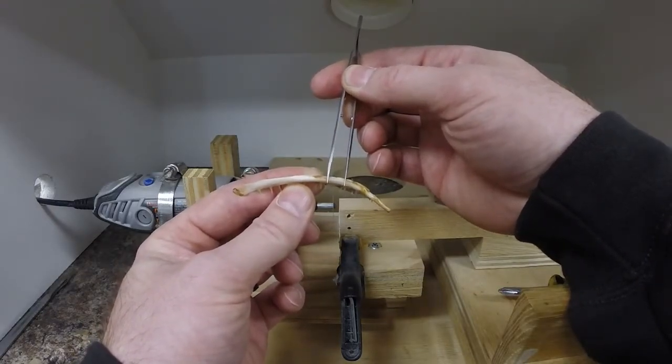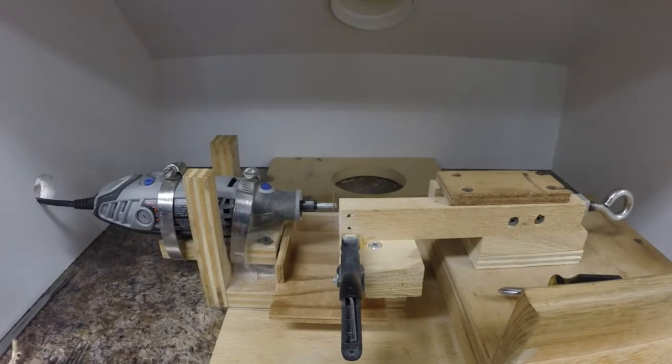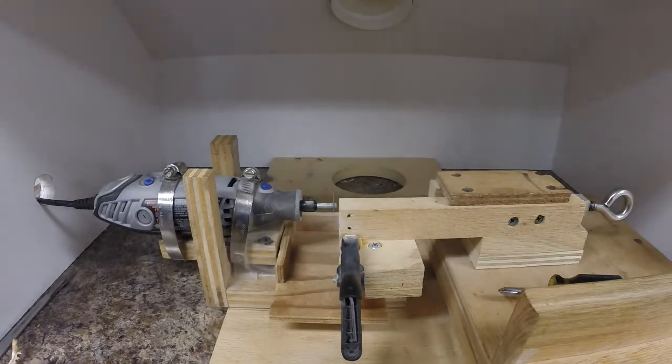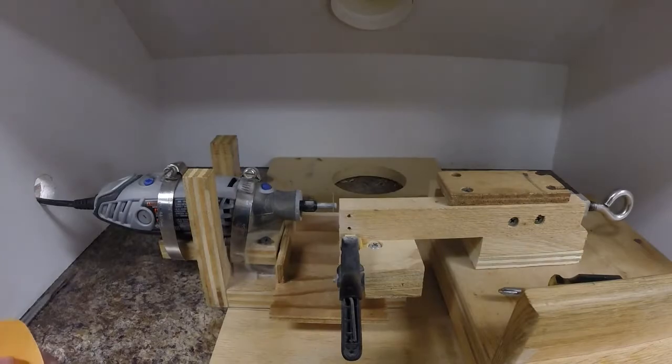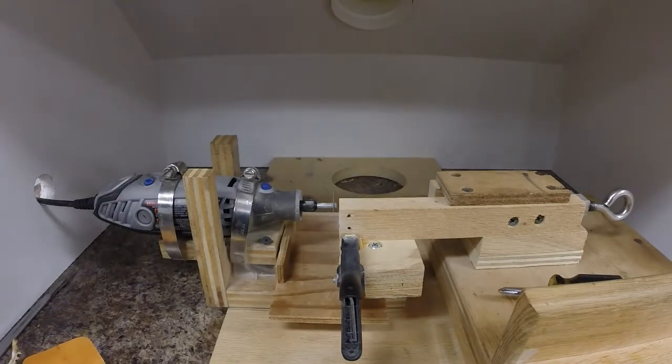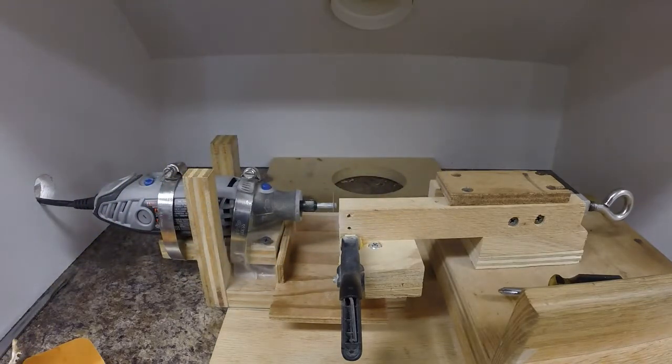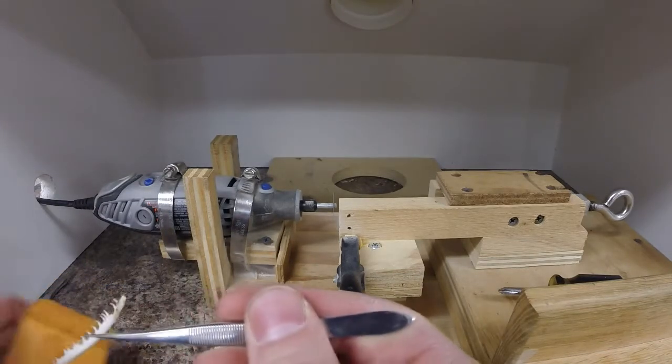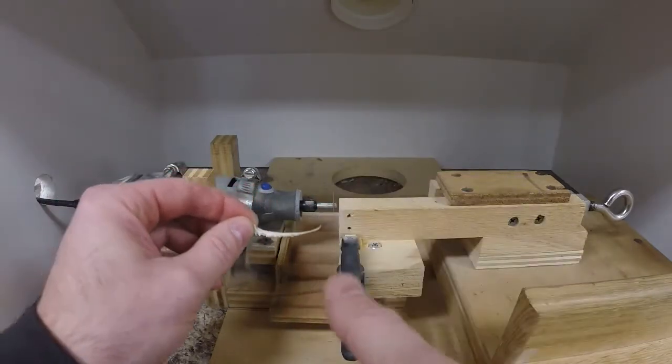So I will cut a couple sections. We have our spine cutter set up in a box with a dust collector. Breathing bone dust isn't really good for you, and we have the dust collector vented directly outside so all the dust goes directly out of the building. Other thing, I always wear my safety glasses. We're dealing with a spinning blade that sometimes shatters, also cutting off little parts of bone, so you want to make sure you don't get that stuff in your eyes.